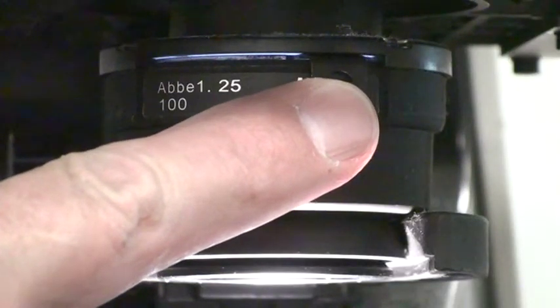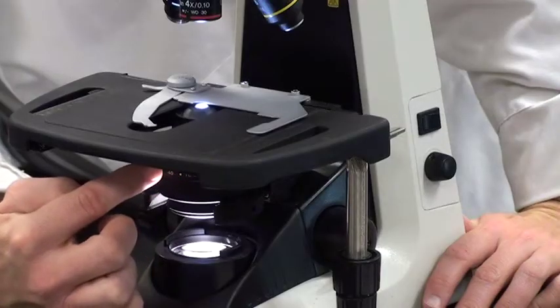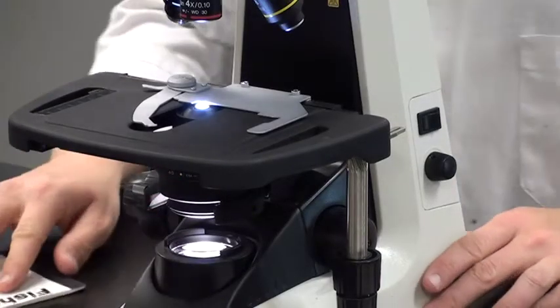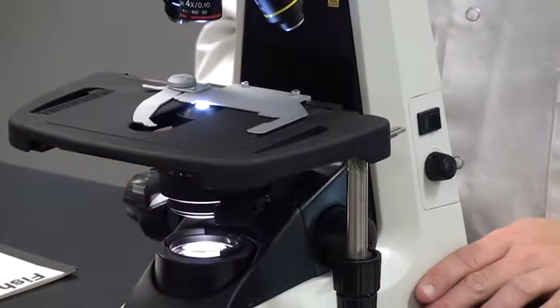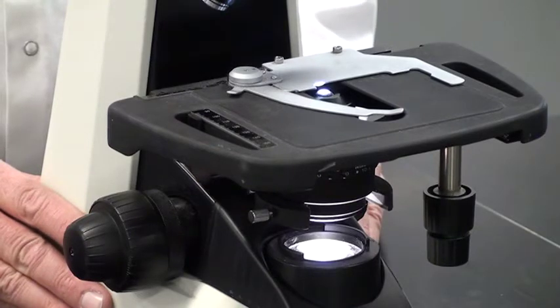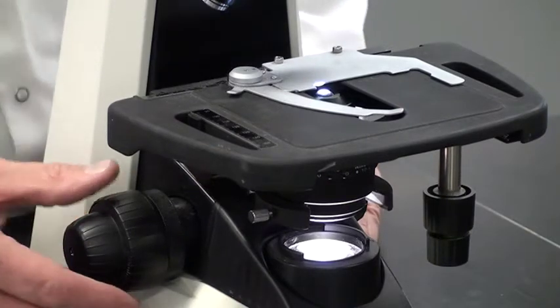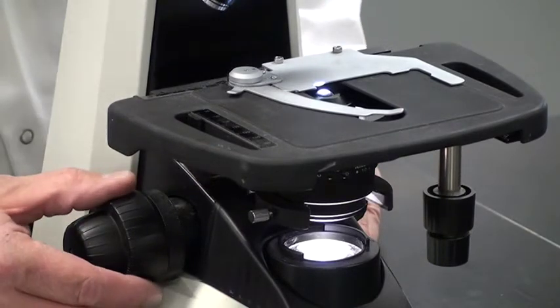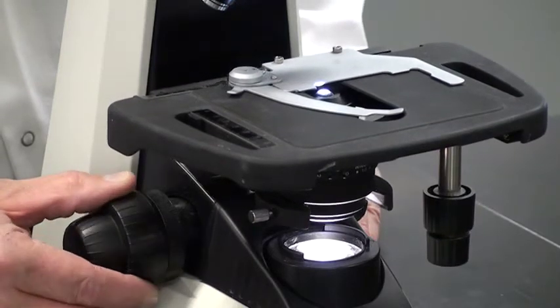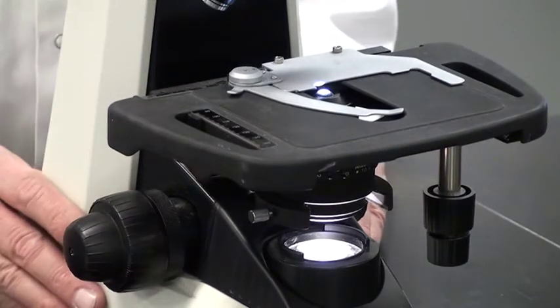Adjust the iris diaphragm until light comes through the condenser lens. After you verify the light is working, place a prepared slide on the stage. Make sure the stage is set to its lowest position to access the slide holder easily.